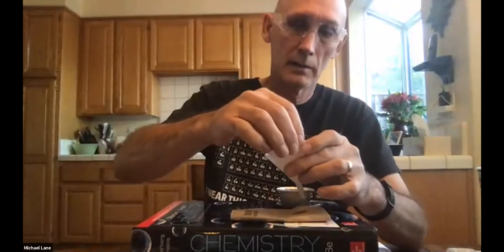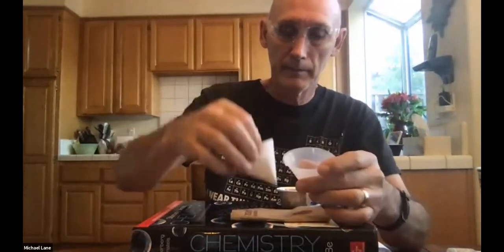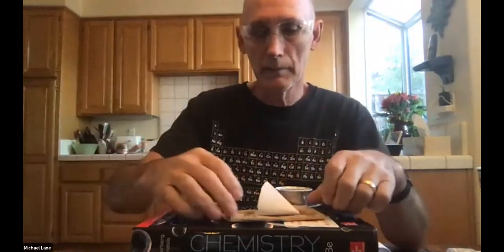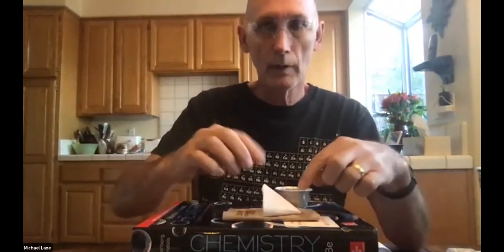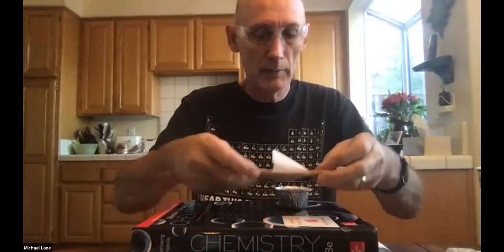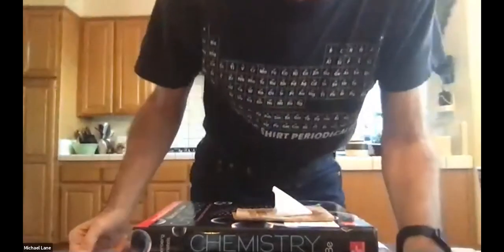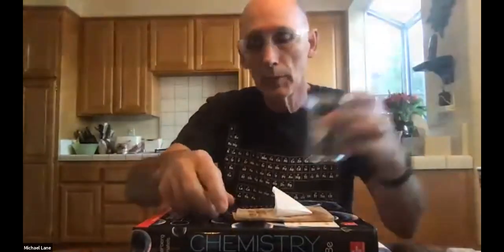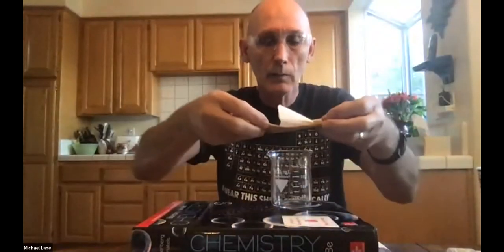And take that out. And I'm going to lay that down very carefully right there. Set that aside. We don't need it. Now, this is what I need you to set aside to dry. So maybe this little aluminum container wasn't quite the right thing. Excuse me while I look in our own kit. You know, anything will do. I'm going to use a beaker. You can use anything that you want to set that aside.